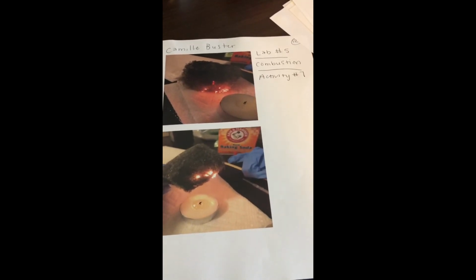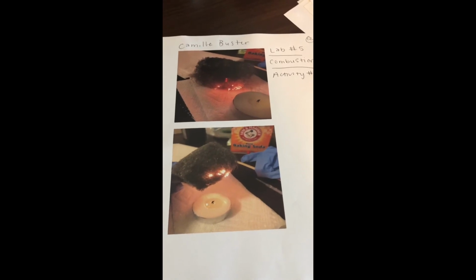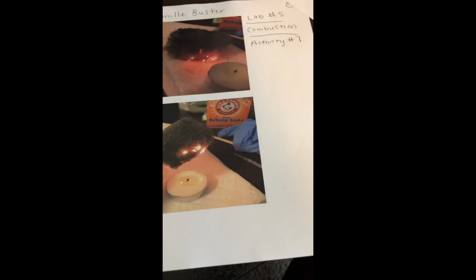And this was activity 7. Lastly, in the combustion reaction activity, the wool pad is introduced to the flame. Here the flame spreads to the wool fibers and starts to coat each fiber and wool particle. So all 7 of these activities create and distinguish a specific chemical reaction.